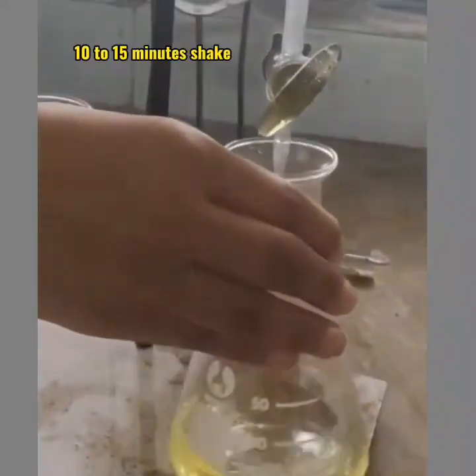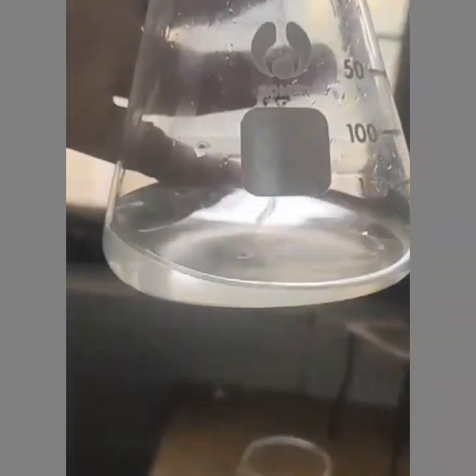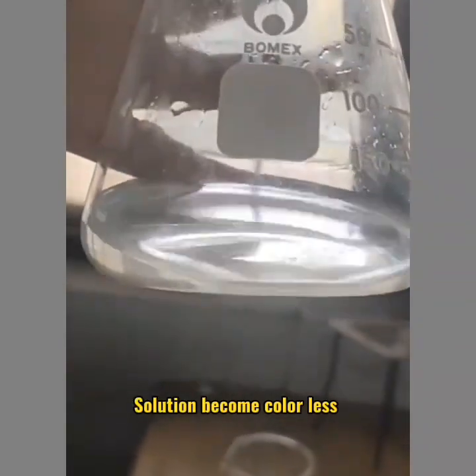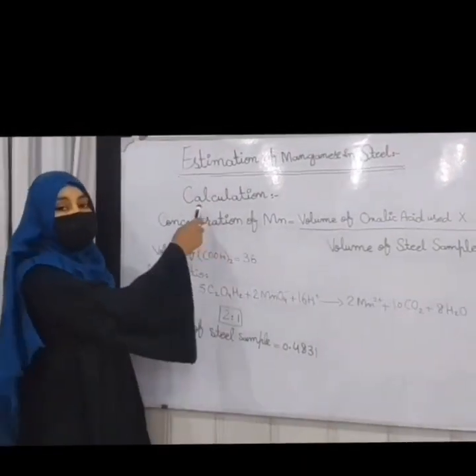Now our solution starts changing color. It means it has manganese in it. The solution becomes colorless, so that is our end point. Here is the last step, and that is calculation.